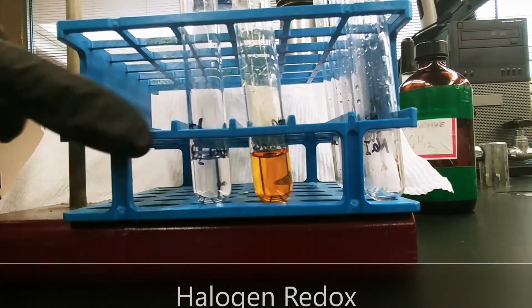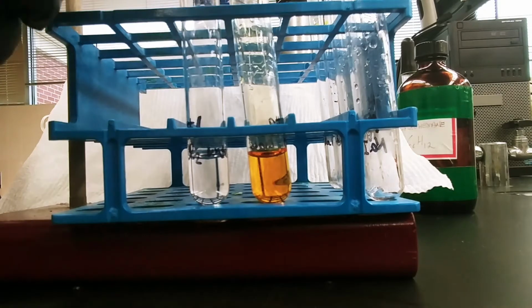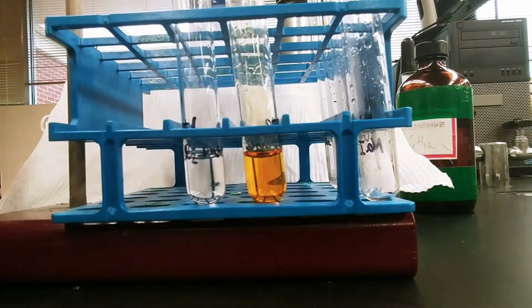So in test tube number 1, I have chlorine water. This is just bleach in water. And then I have bromine water, which is bromine put into water. It does color the water a little bit, so we know that there is some bromine in there.